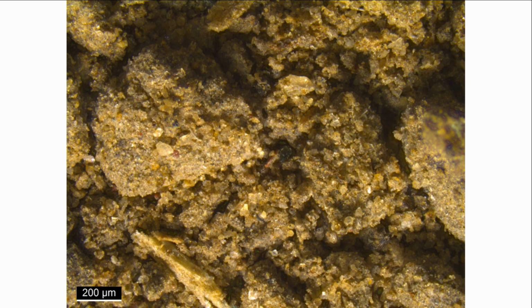I won't say it looks beautiful under a microscope, but these silt grains stuck together with the matter left by centuries of organisms living and dying are where plants thrive to produce food for all terrestrial life.